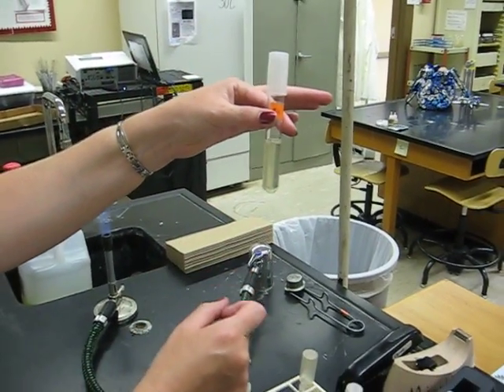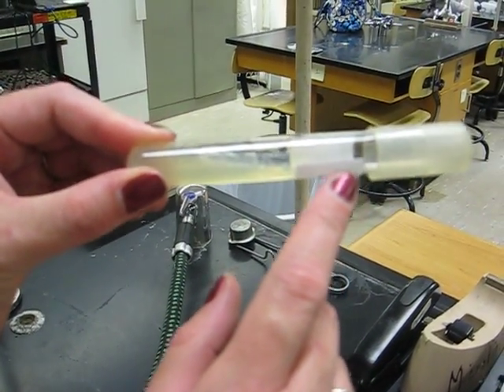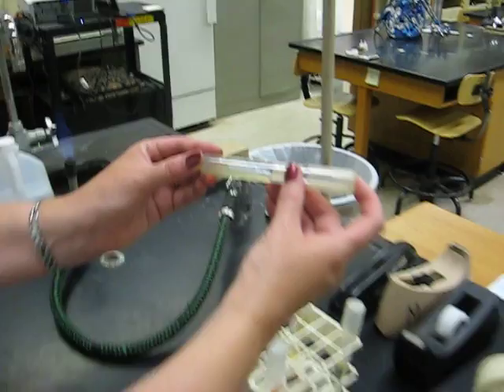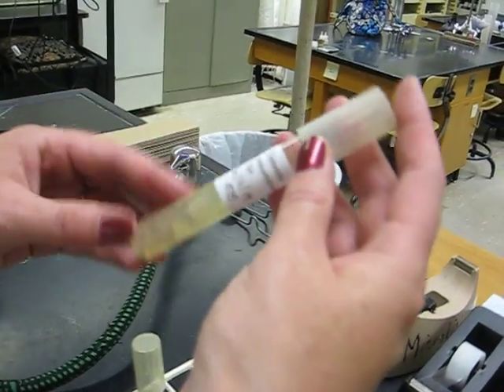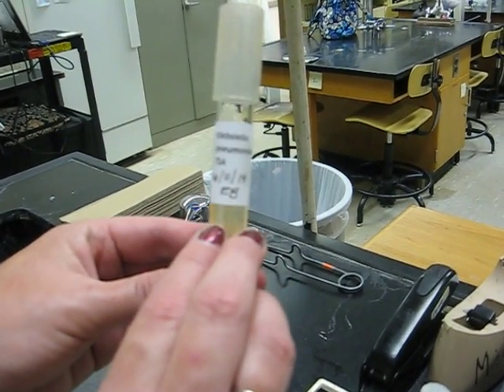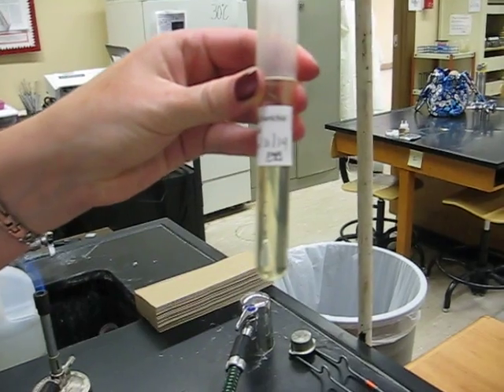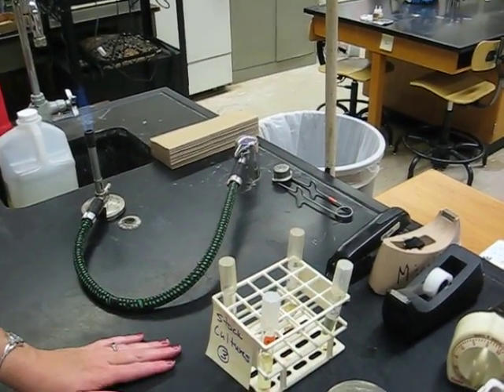You want to suspend it as best you can so that you pick up bacteria. This is a slant culture — it's agar in a slant inside of a tube. You'll see the name of the organism, Staphylococcus epidermidis, the date it was inoculated, and my initials. You can see the nice creamy white appearance to the growth. This is another creamy white one but a different organism — the label says Klebsiella pneumoniae. It's on a different type of media: TSA stands for tryptic soy agar. Then we have a broth culture of E. coli — you can see it's kind of cloudy, not as much as the mixture since there's only one organism in here. Make your observations.